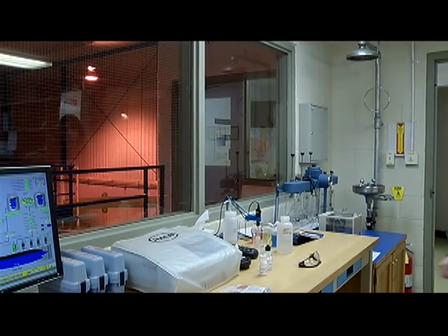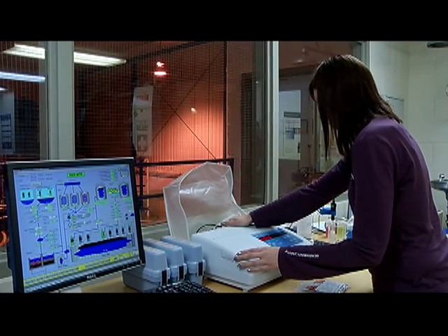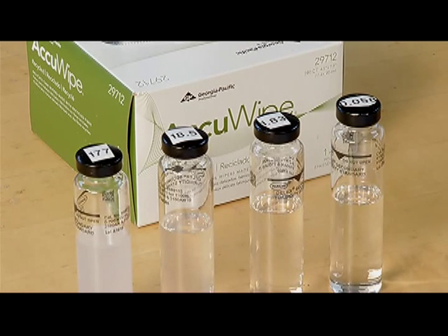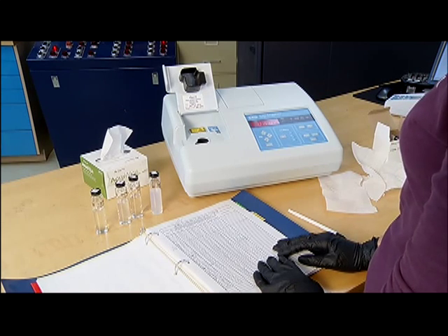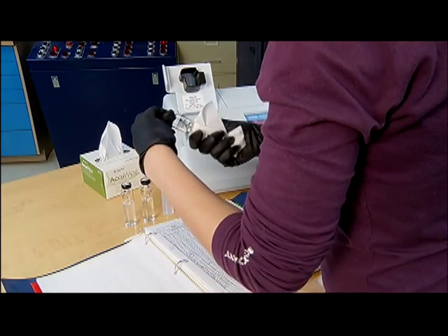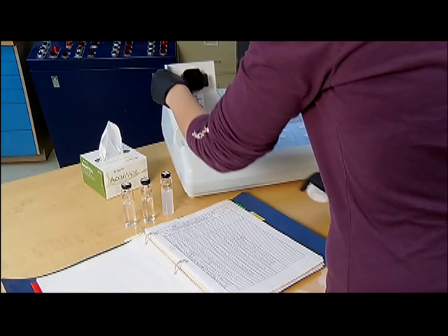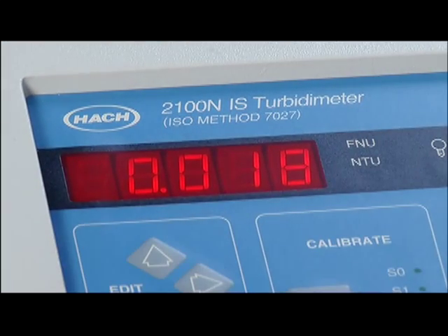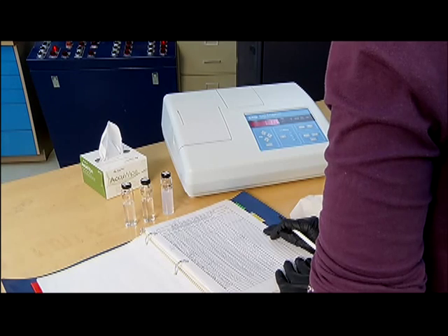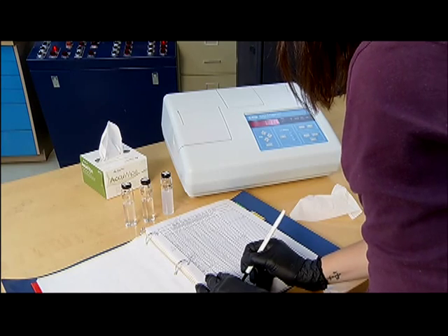In this illustration, the operator is using secondary standards to calibrate a lab turbidometer. The operator has assembled the standard solutions and the facility's QAQC log. The operator cleans the first standard solution with a lab wipe, aligns it in the instrument as required, closes the cover, notes the reading, and records the instrument calibration reading in the QAQC log manual.